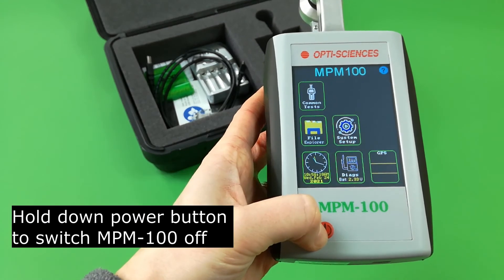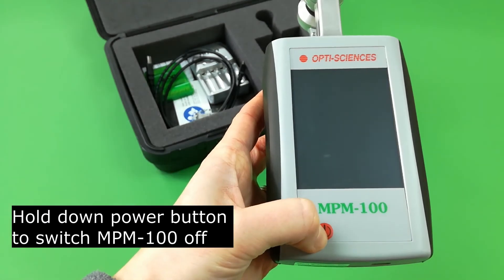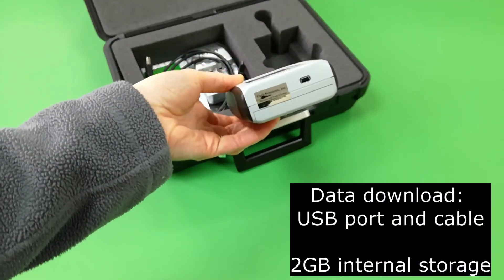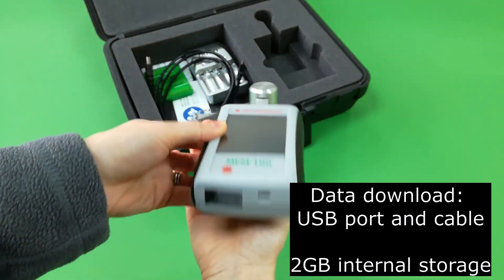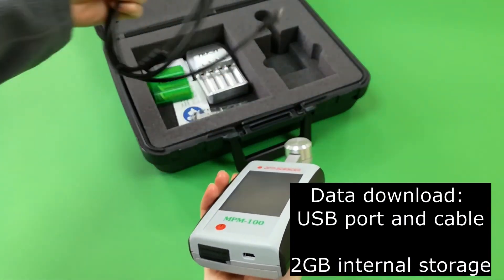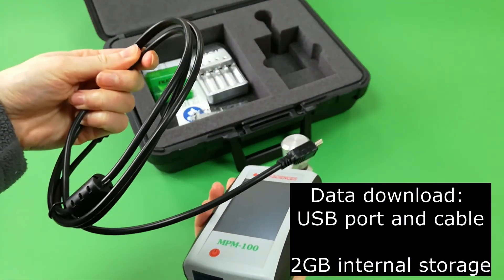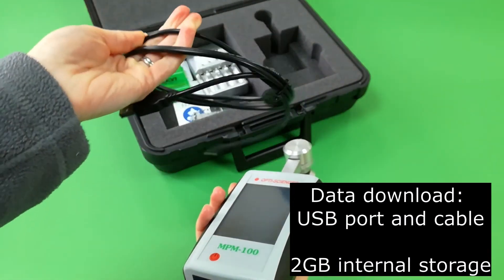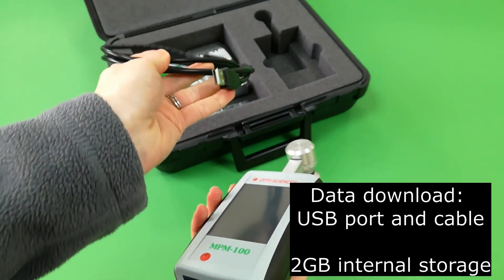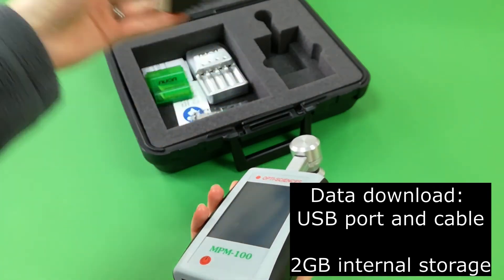Hold down the power button to switch the MPM100 off. Data download is via a USB port and cable. Two gigabytes of internal storage are provided.